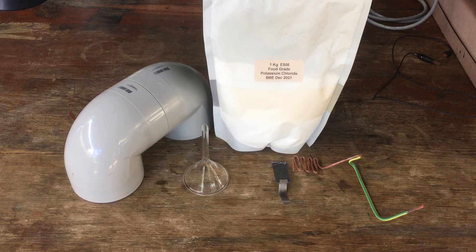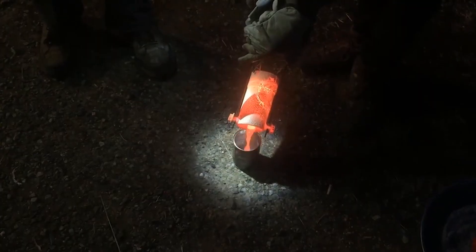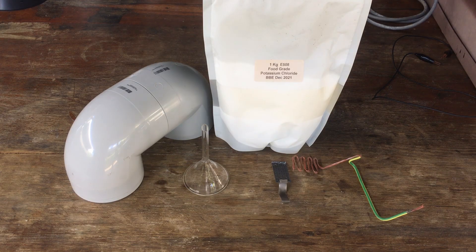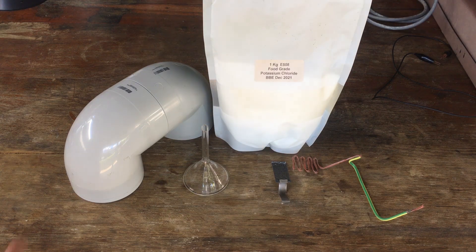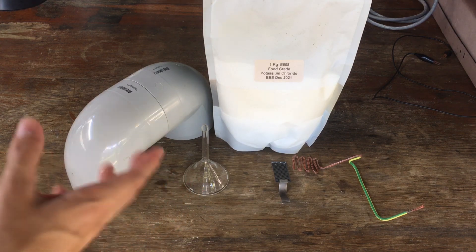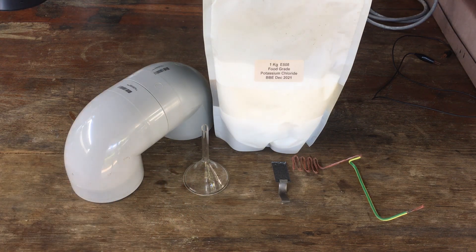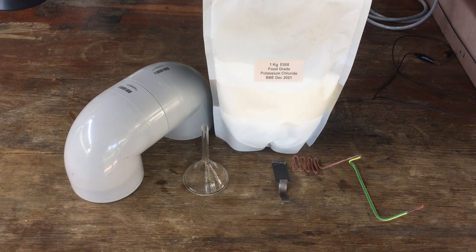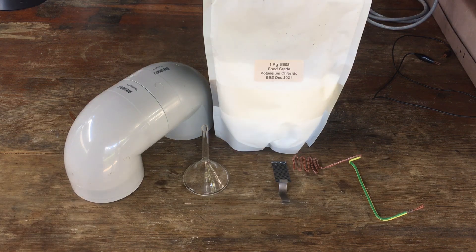Hi guys, Harry here. Welcome to Scrap Science. This video will likely be my last video, at least for a while, on the topic of the chloralkali process. Today, what we need to do is generate some potassium hydroxide, because I need some for a future project.